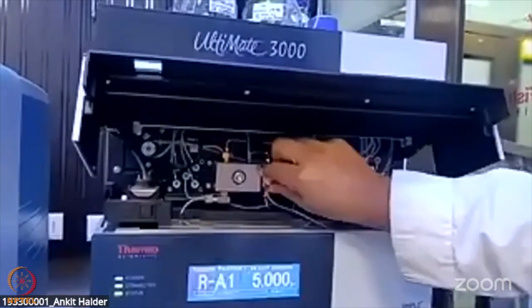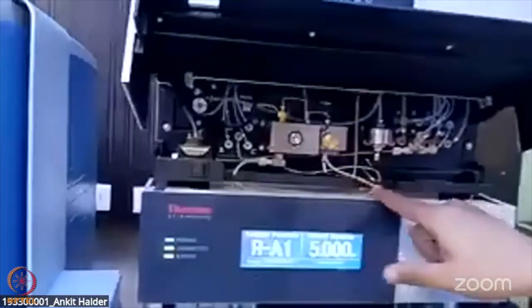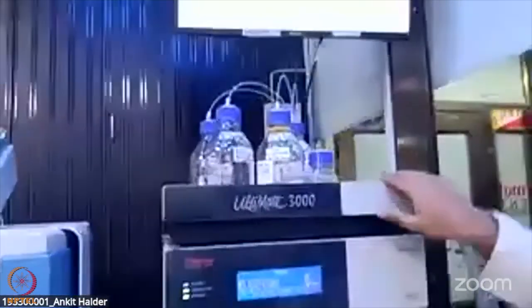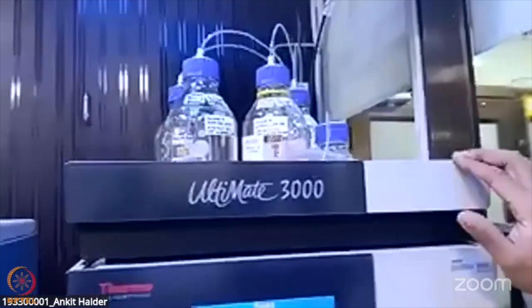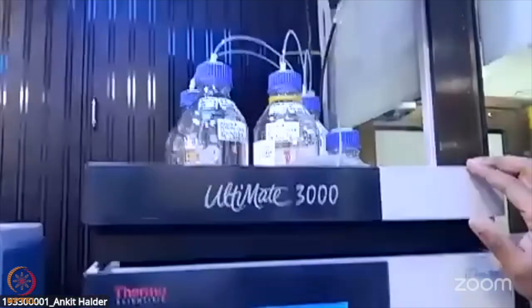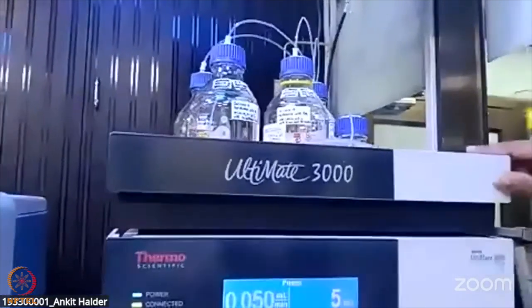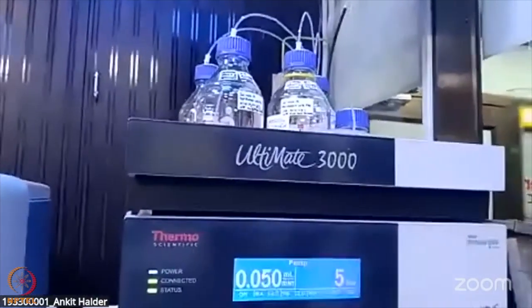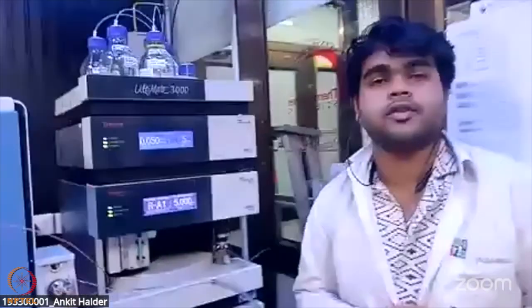So basically, if they have purging, you will see all the bubbles getting out of this particular pipe. Now the final rack is the solvent rack. In the case of lipidomics, you use a quaternary solvent system, and in the case of metabolomics, you use a binary solvent system. So in lipidomics, you use 4 different solvents: solvent A, B, C, and D. One of the most important features of this mass spec is that it can give us the information about the protonated and the deprotonated metabolites or even the lipids.